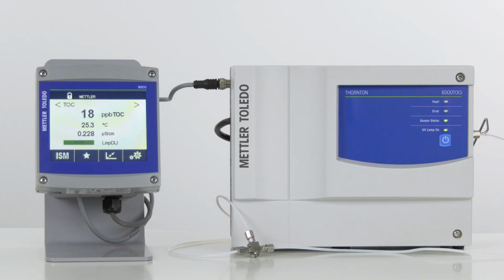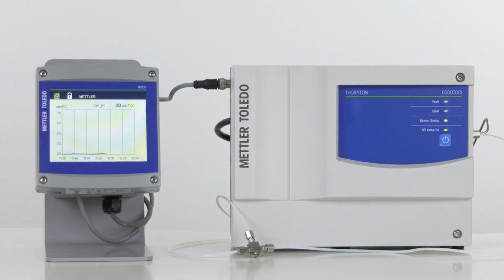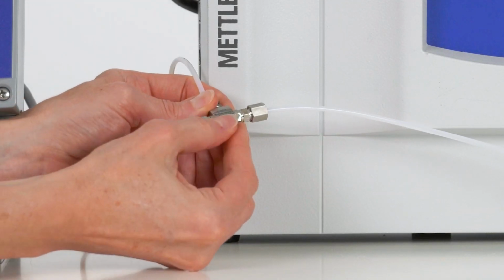What I'm going to do is use the three-way valve to introduce a source of contaminated water, and we'll watch the measured TOC concentration change as a result of that contamination. Now I'm going to switch the transmitter screen over to the graph so we can see that excursion in real time, and I'm going to switch the water over to the contaminated source.